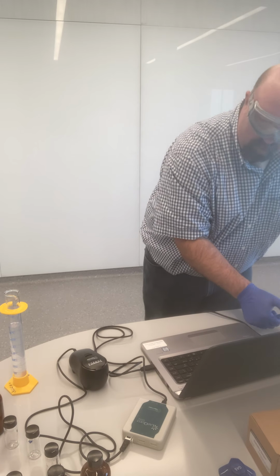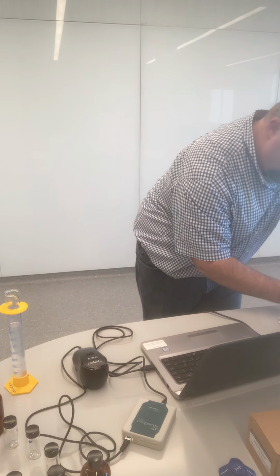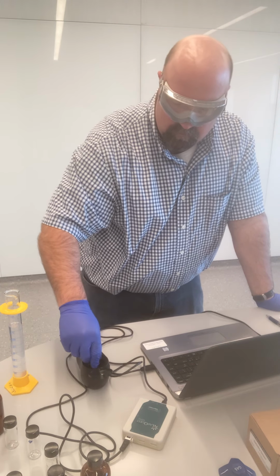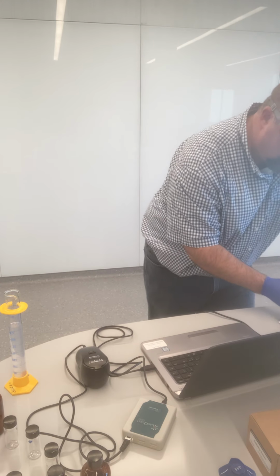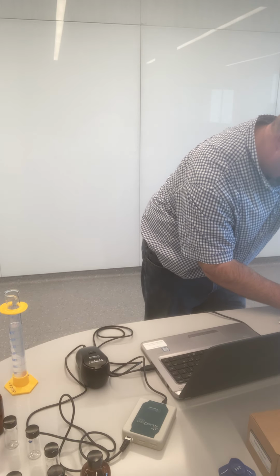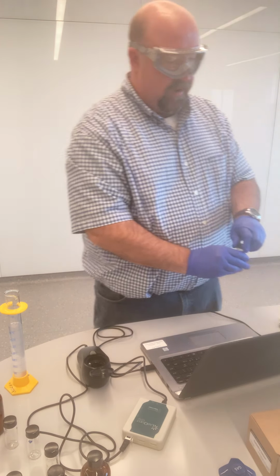I get 33.3 NTUs. 32.6 NTUs. And 34.1 NTUs.